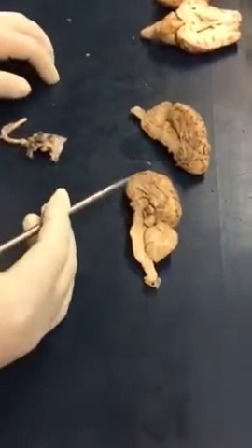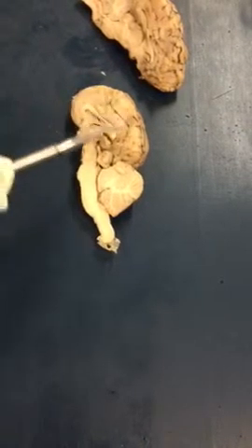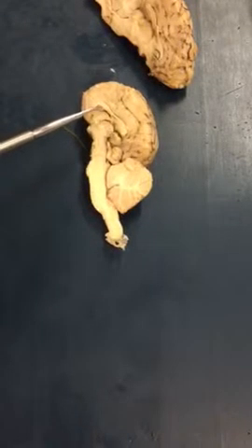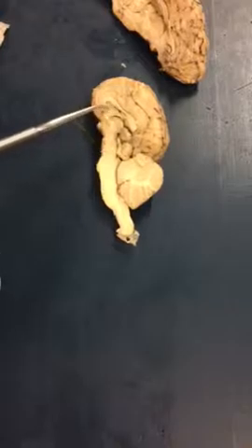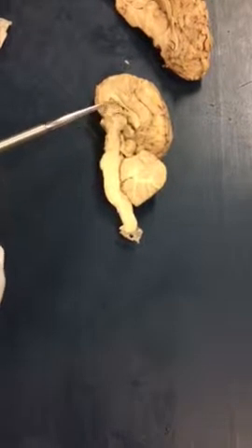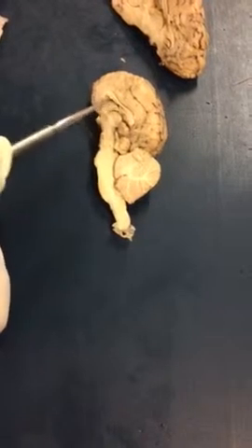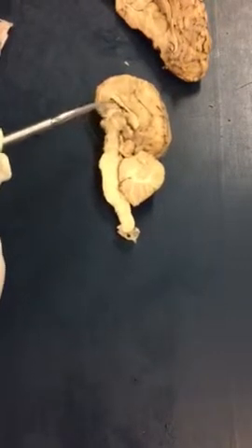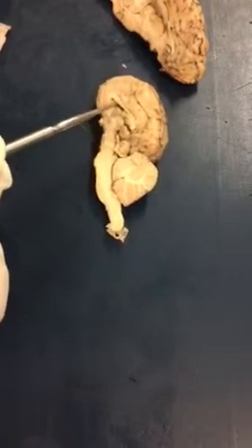Alright, so on this one, you're pretty much going to see, here's obviously the cerebrum. You see the gray matter up here, the white matter down here. Here's your corpus callosum. The inferior part of that is going to be your fornix. There's your septum pellucidum, kind of. It's kind of gone already, but it would have been there. And then where the probe is, your lateral ventricle. So that's where you make the CSF.